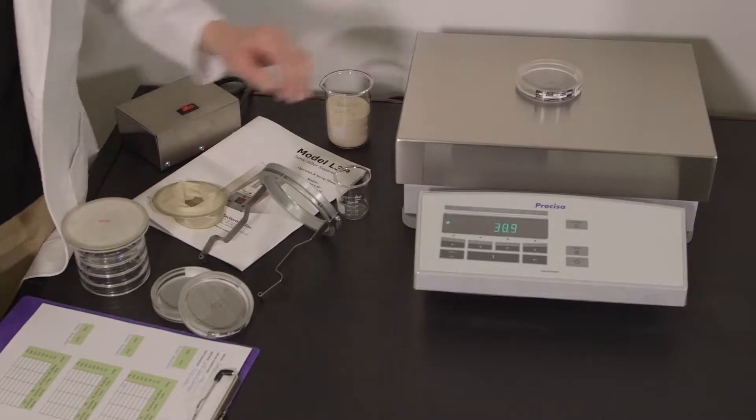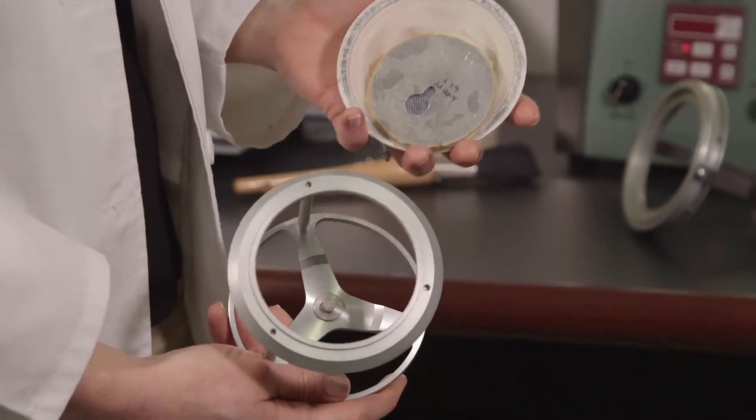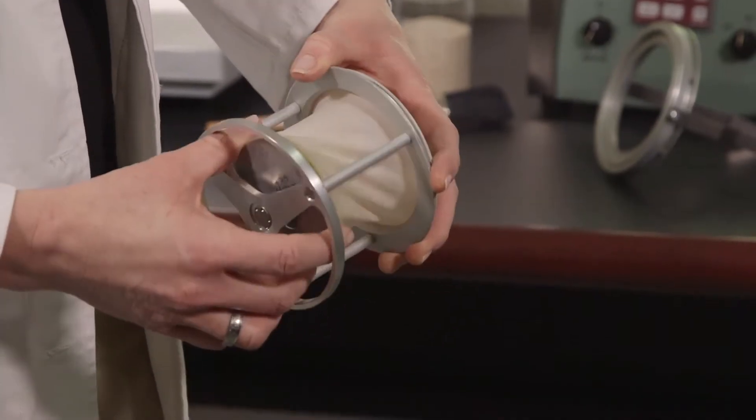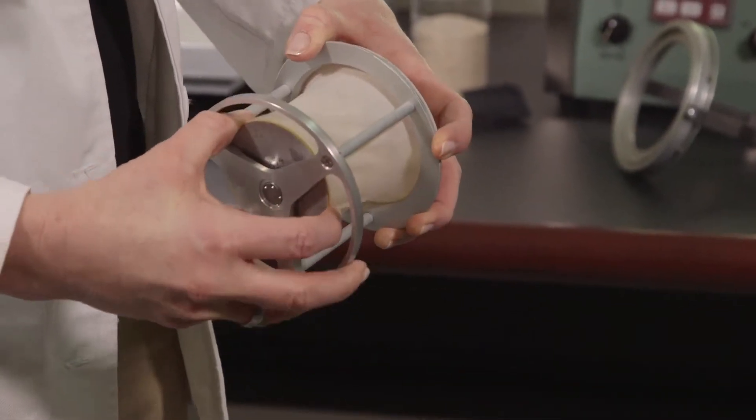Before testing begins, be sure your sieves are clean and dry. Weigh and record the tare weights of diaphragm, top cone, spacers, sieves, and fines collector.